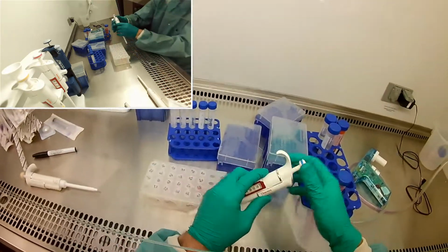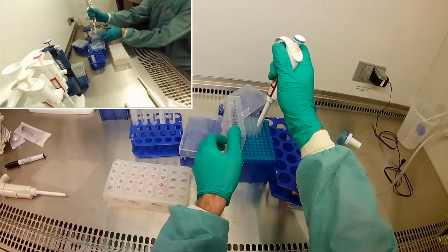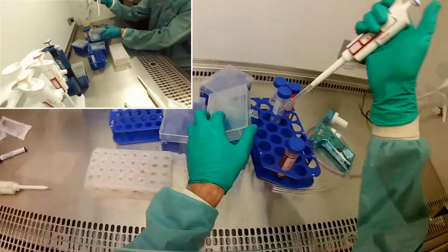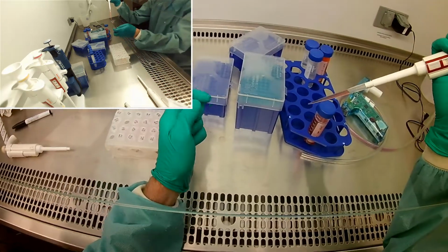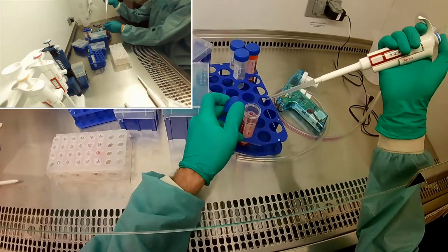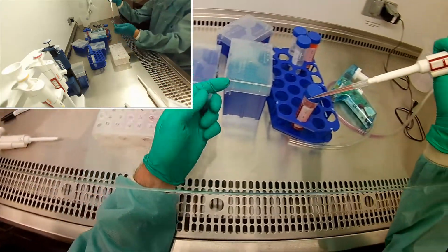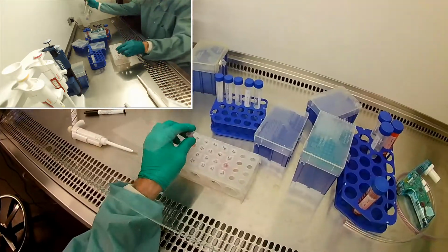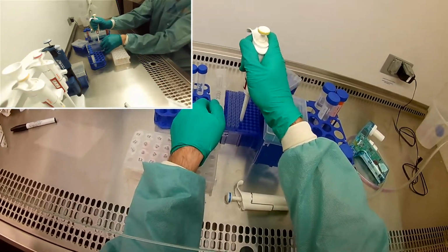Okay, and we're going to repeat the exact same thing for bleach because it's the exact same calculations. I'm going to do 920 twice of bleach to get, or of the media. To make sure I didn't do it already. And now 160 of the bleach.